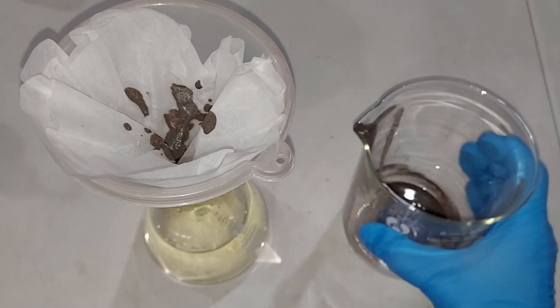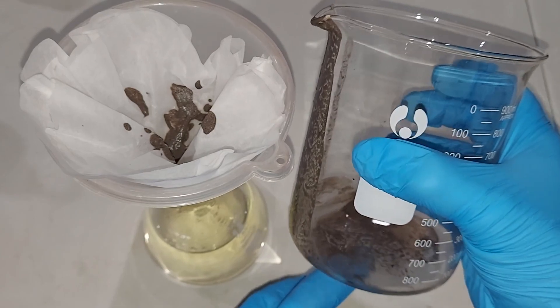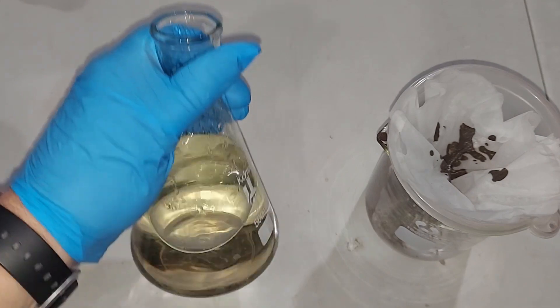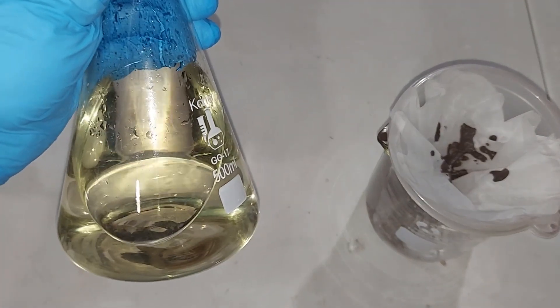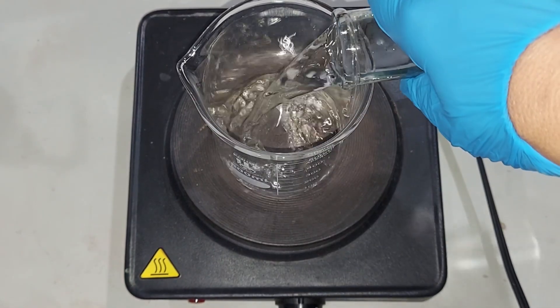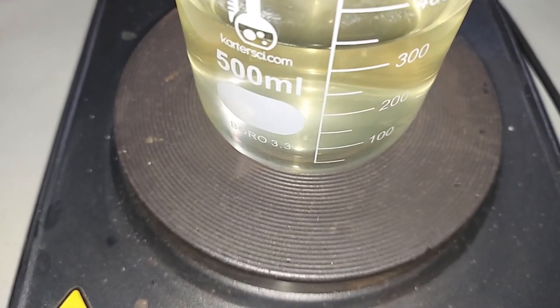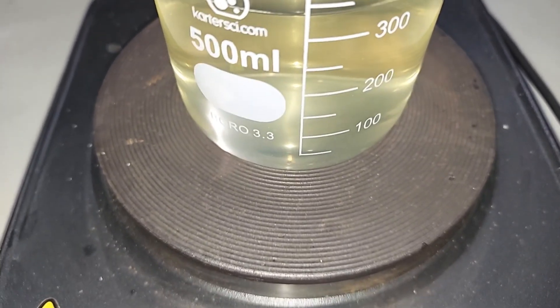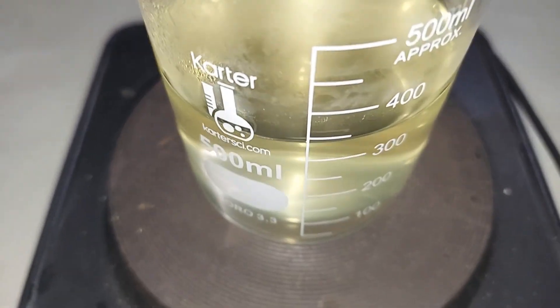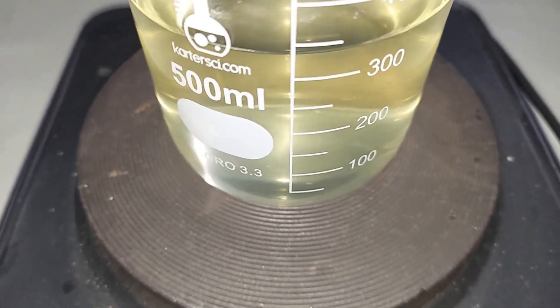This filtered solution is what we need to work with next — we're going to boil it down to get rid of some of the water. I'm transferring this to a 500 mL beaker. I keep this from fully boiling because of somewhat unknown factors regarding when potassium carbonate actually breaks down. We've lost about 200 mL so far — it started at about 500 mL and is just below 350 mL right now.